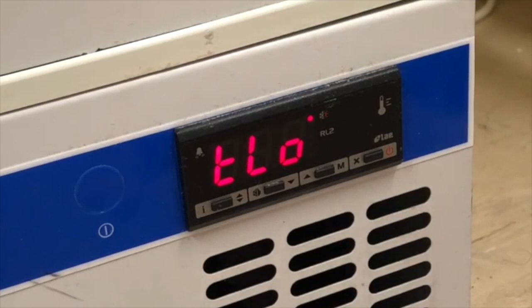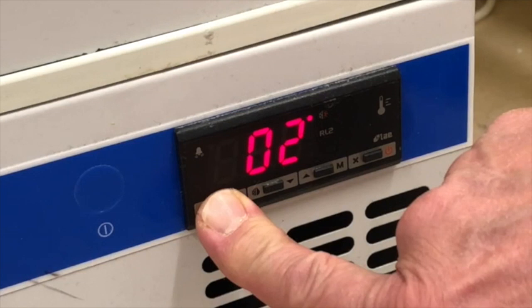Do not insert a decimal point if this is not illuminated in the display. It's normal to have a zero illuminated in front of the number.